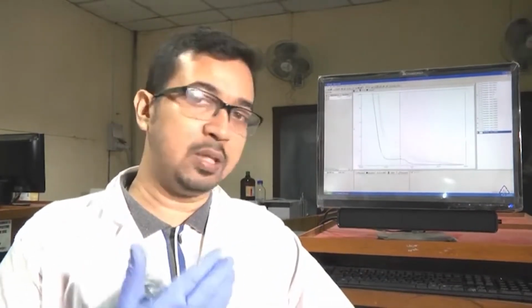So if you add protein plus component A, which gives the solution, then in the control you have to take only component A without protein. Why? Because if component A has any sort of contribution in the absorbance, may not be a peak or some other contribution in the absorbance, it will get nullified. So what you have to do is that after you have taken, save these files as data format, then again take the absorbance value of the control.